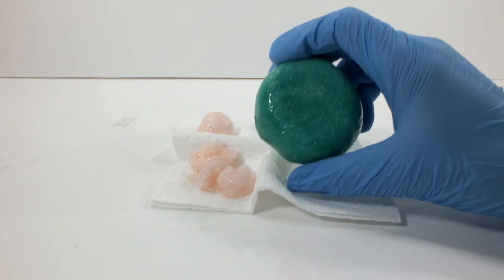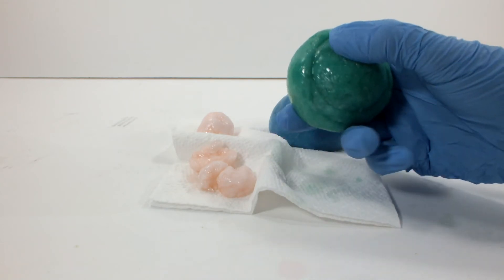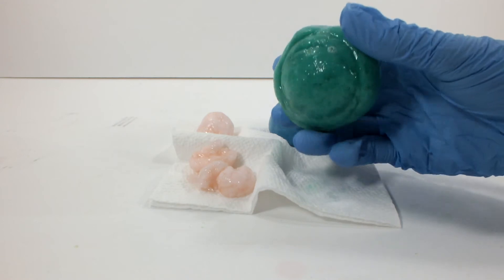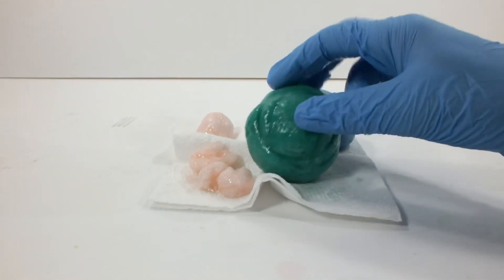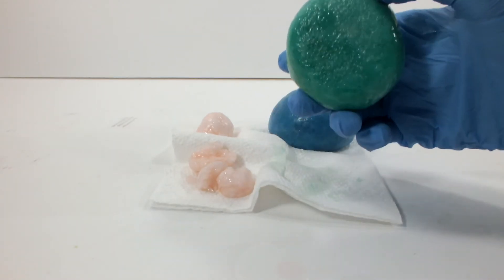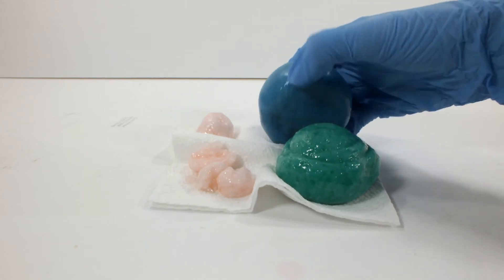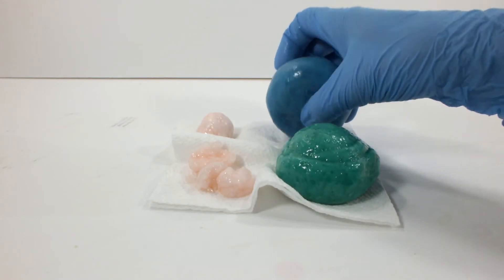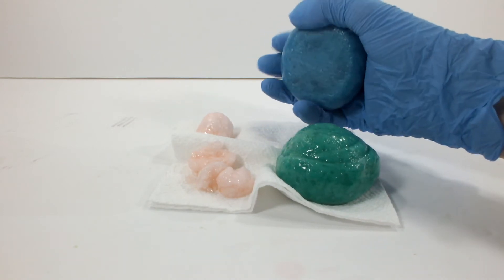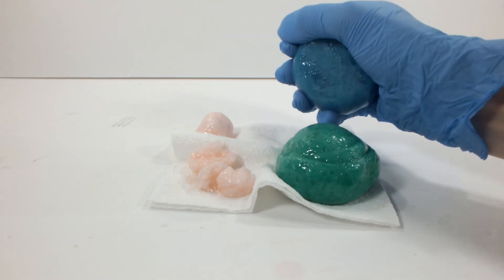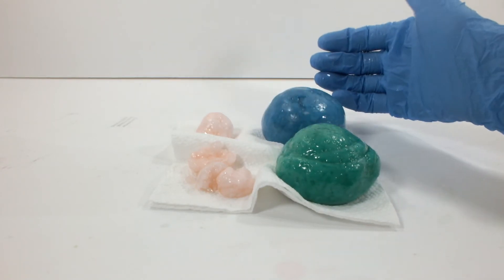This one I rinsed off, but it's still got some goop on it. And when it fell in, I set it on top of one of those little medicine cup things, and that's why it's got this little ring around here. Anyway, this was good before I dunked it in the drink. And then this is the last one I made. And they all take on this thing from the napkin just because I'm not really sure where else to put them. But it does show that despite being quite hard, and oozing out everywhere, it is still somewhat of a fluid. And it will go towards gravity.